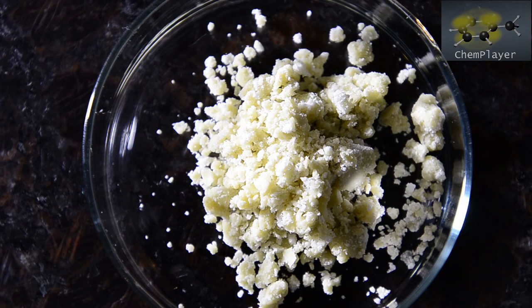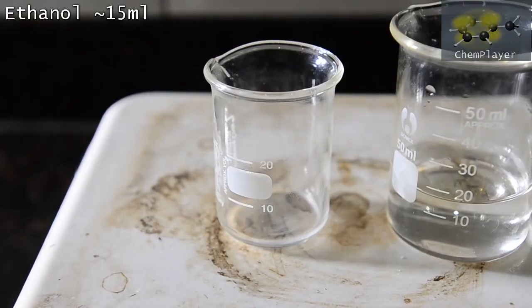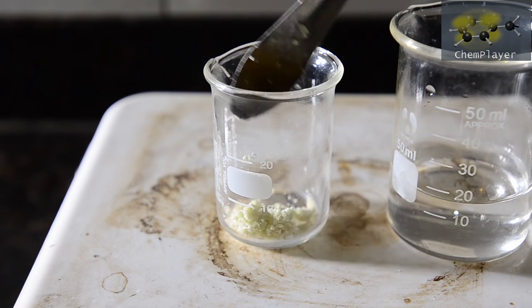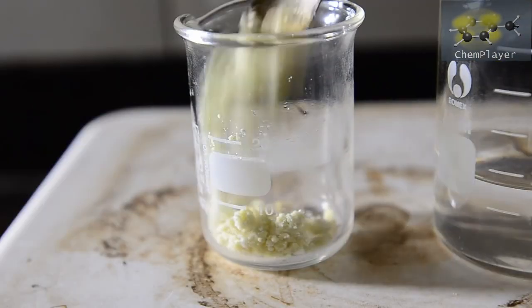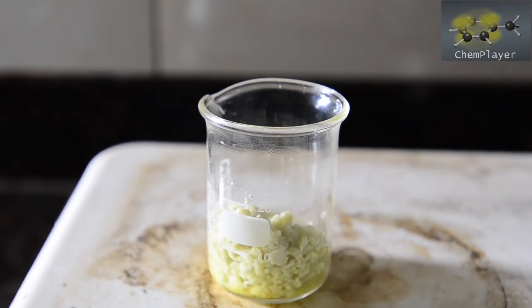So we're going to need to recrystallize this in order to get a purer product. We're going to use hot ethanol for the recrystallization. Let's get our crude product into the beaker. And let's add some ethanol to start to dissolve it.